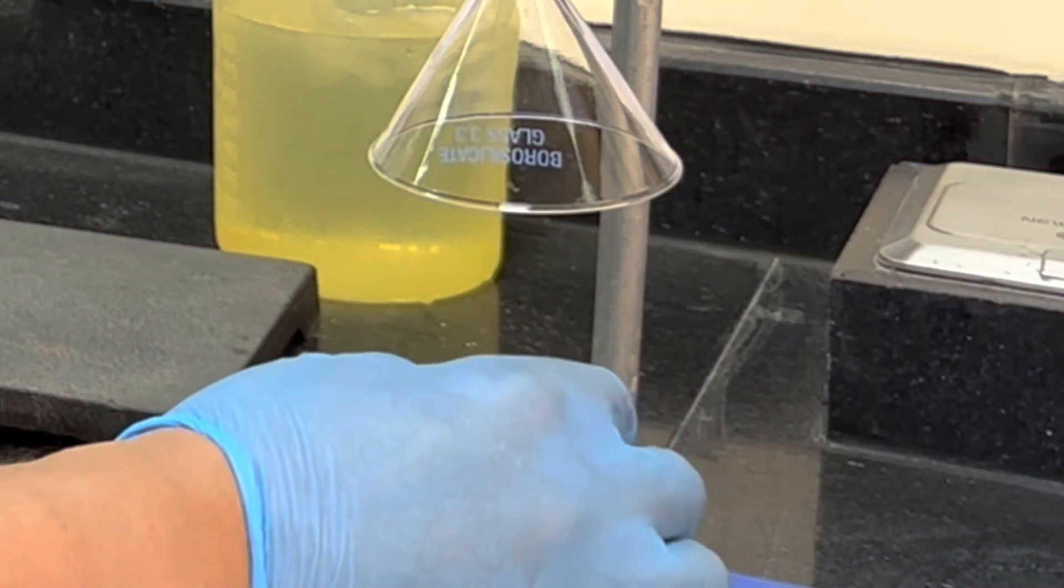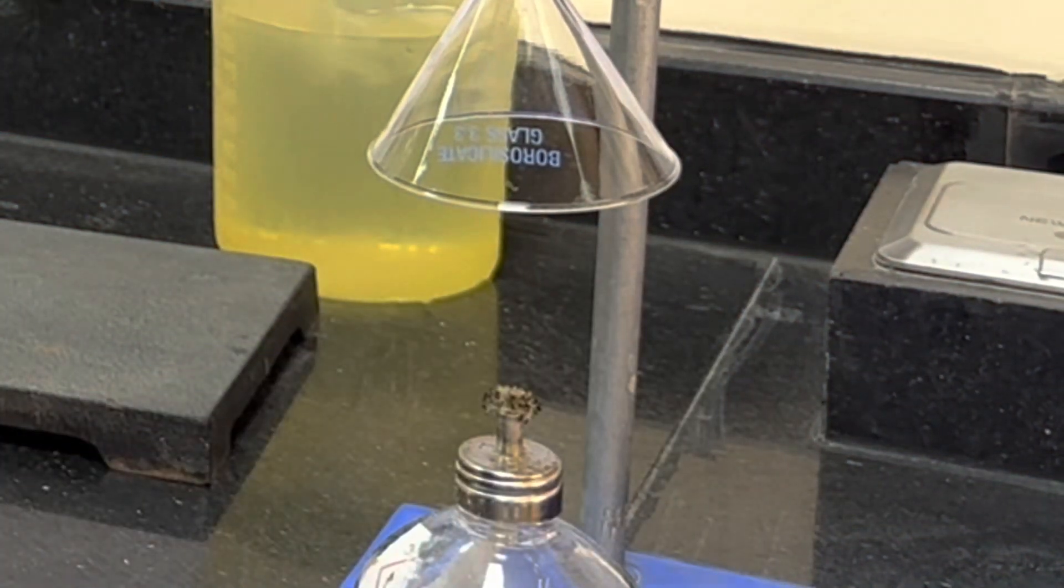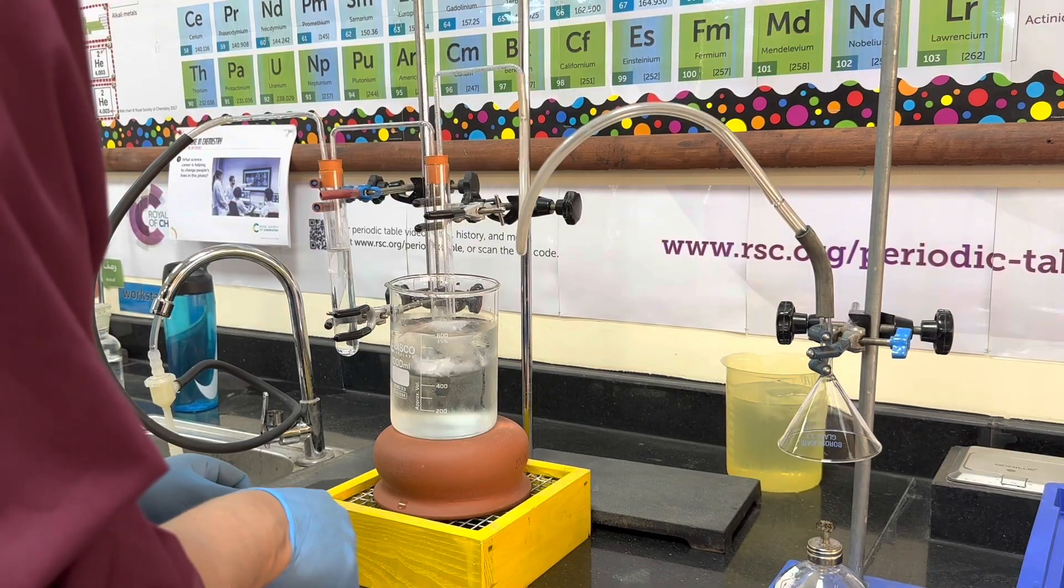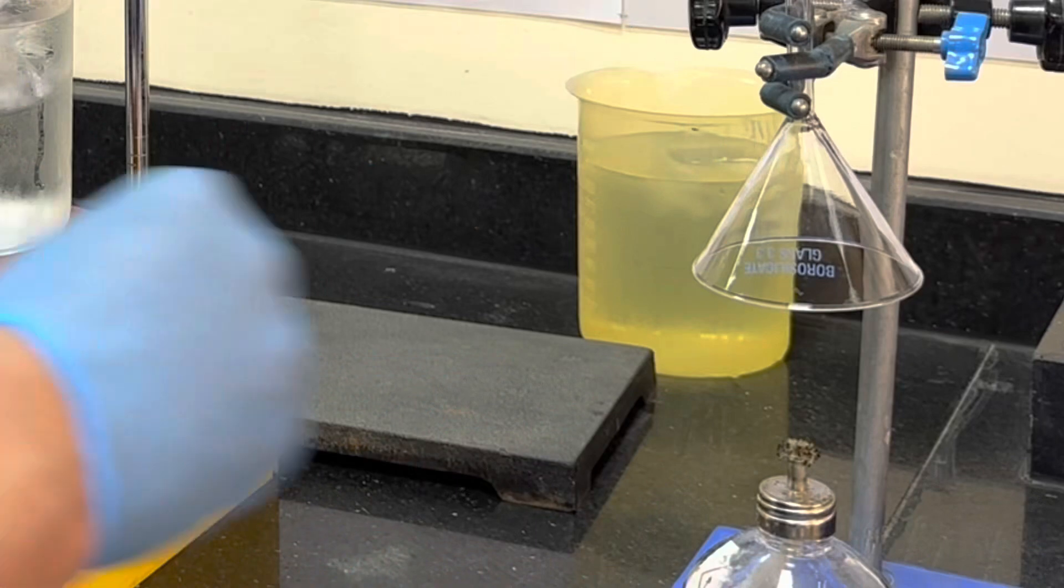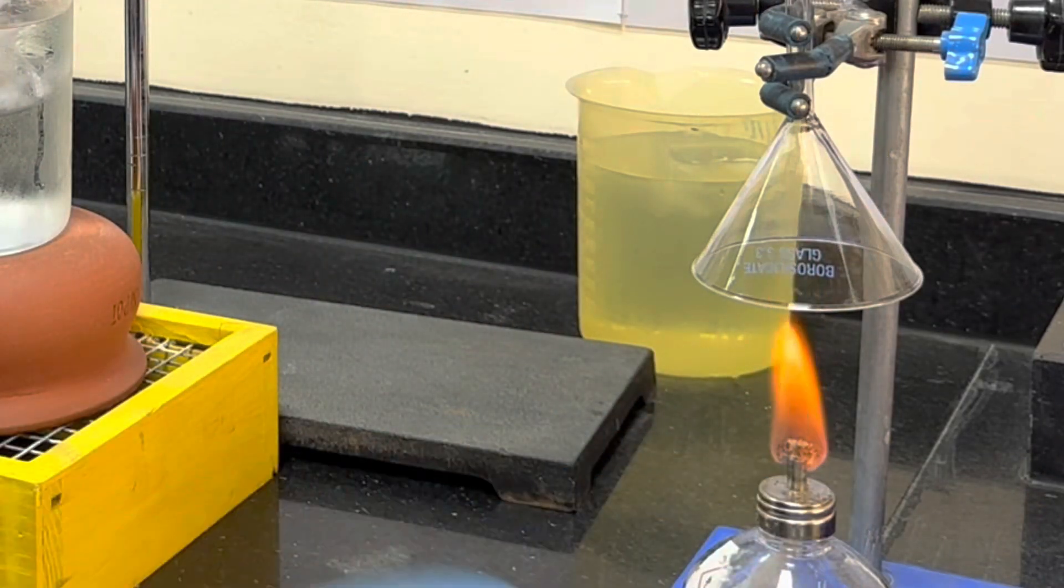Hi and welcome to this video, which is a demonstration of the products of combustion. Combustion is an oxidation reaction. If we have a fuel, we expect to find two gases forming.